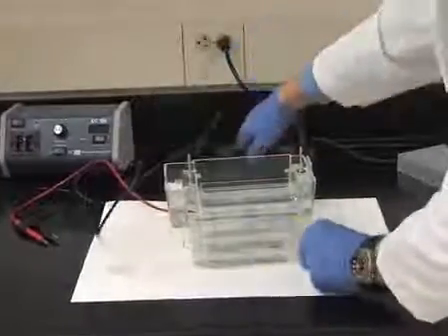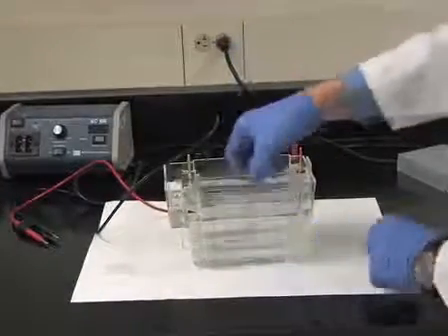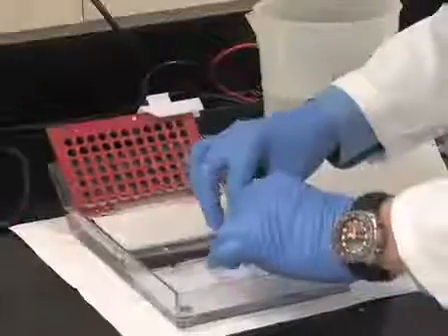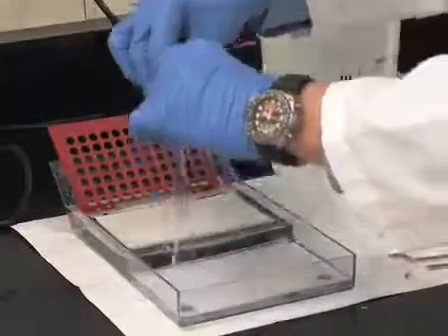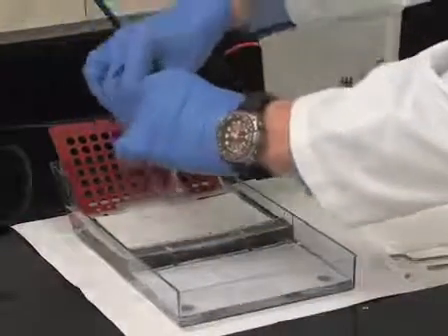This procedure typically follows 1- or 2-D gel electrophoresis and involves the transfer of separated proteins to nitrocellulose membranes.